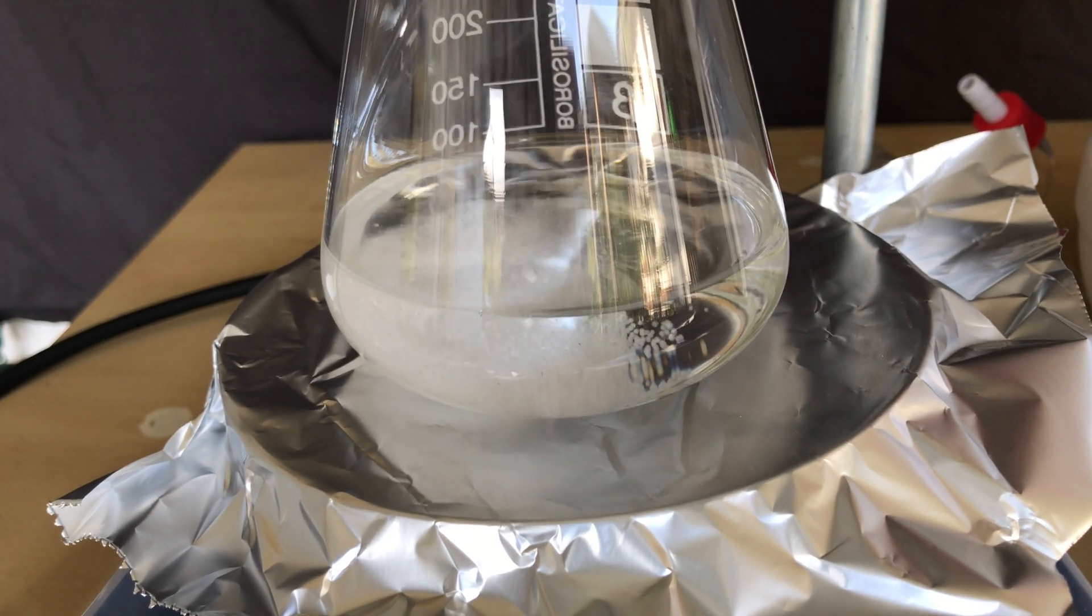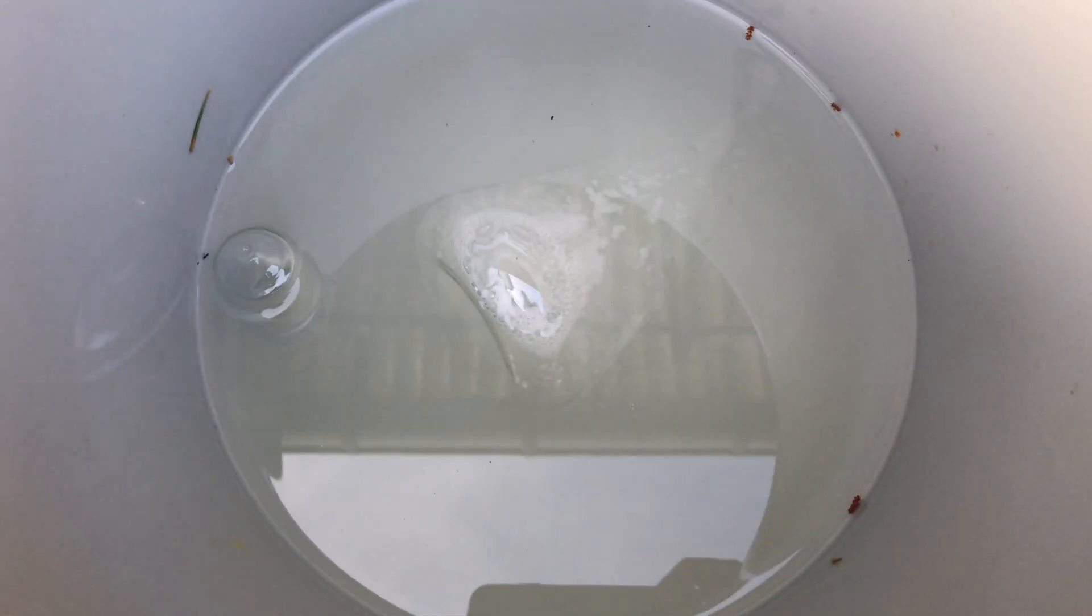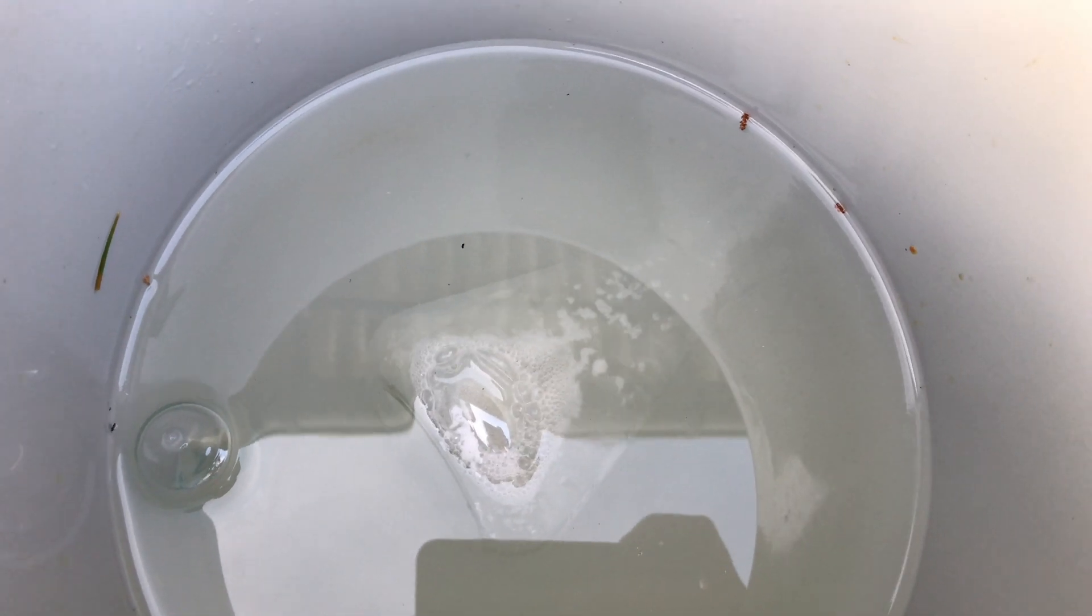First only a small batch of sodium hydroxide was added, followed by cooling down the flask in an ice bath.